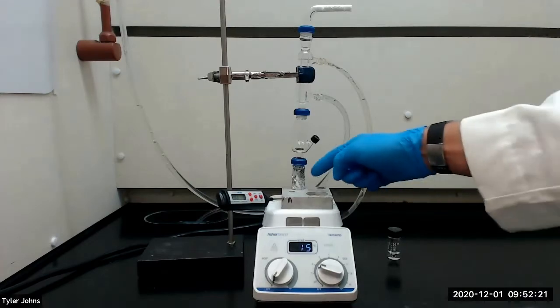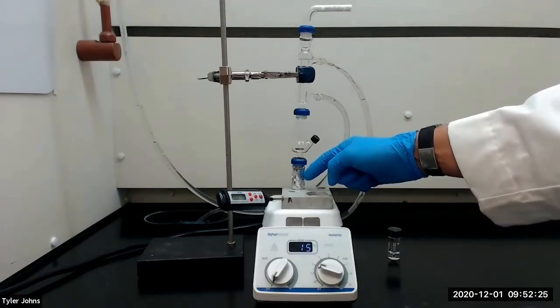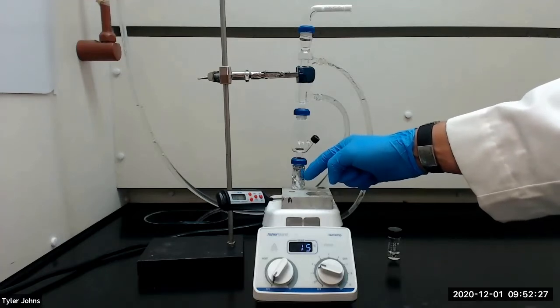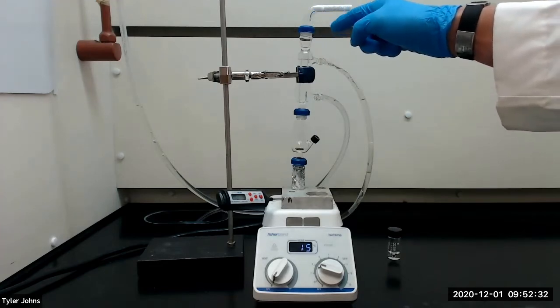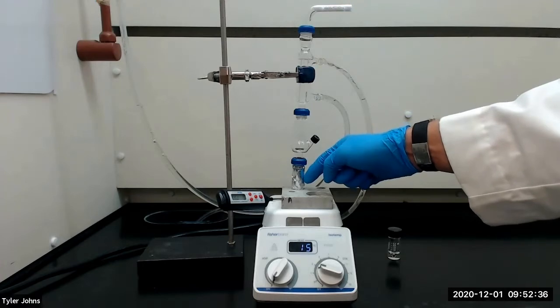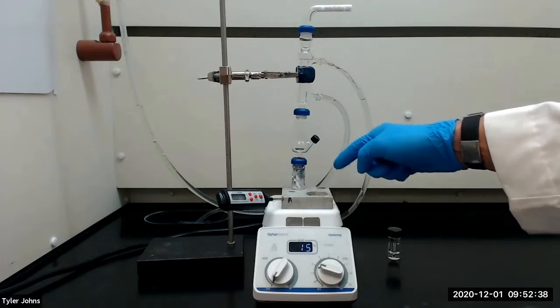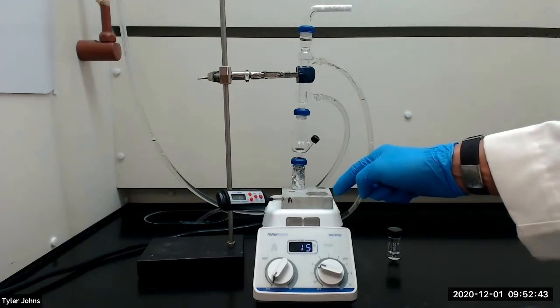After mixing, I've wrapped our conical vial containing the reaction reagents with aluminum foil and connected it to the distillation apparatus which consists of a Hickman head still, a water-cooled condenser, and a drying tube packed with anhydrous calcium chloride. We will heat the reaction mixture until the product begins to distill. The aluminum block should be between the temperatures of 160 and 180 degrees Celsius.